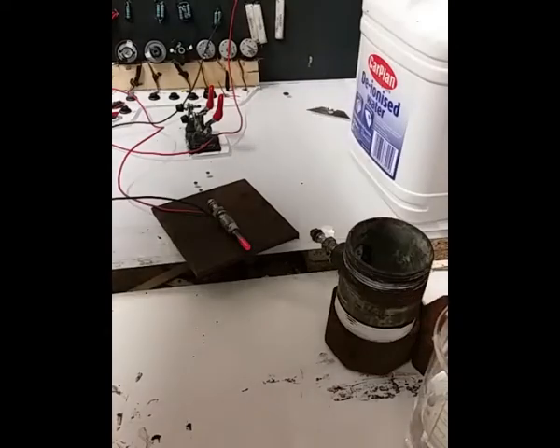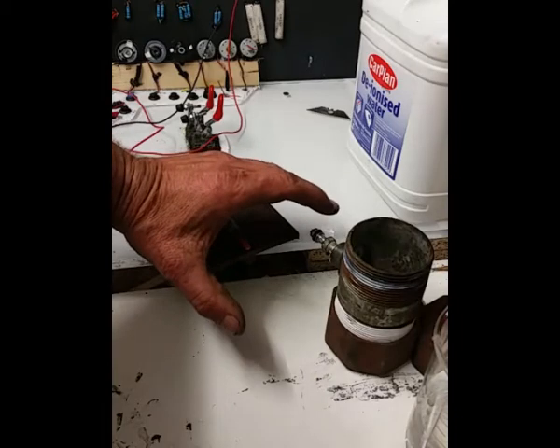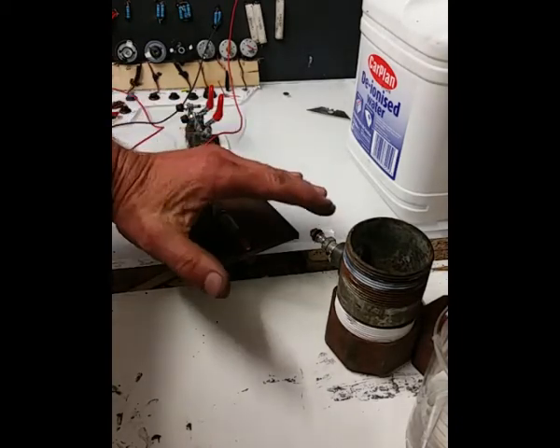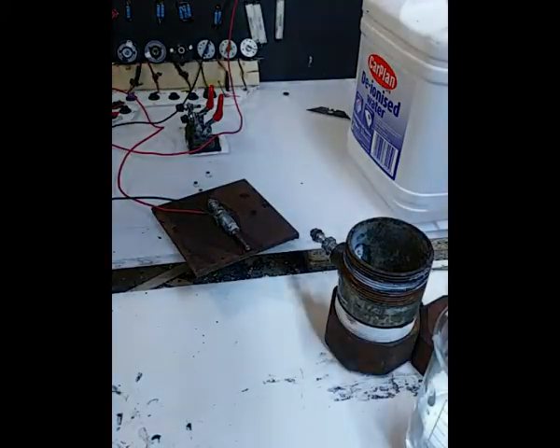Now I've turned it down to 4.8 volts and we're drawing 4.1 amps of current. Obviously it's not particularly glowing red now. Well, it is, but you can't see that. So I'll just pop this light back on, and there you go.